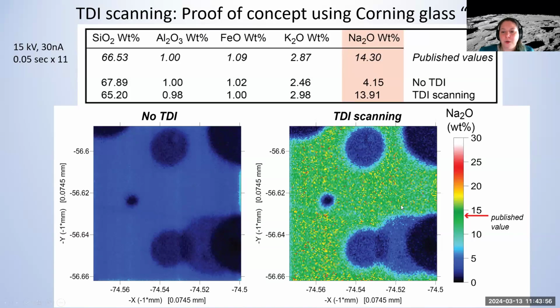But with a mapping, all the dark blue ones, even in the corrected value, are previous analysis spots. And you can see that they have lost various amounts of sodium. But here in the main area, that's where I can now securely export my data from, knowing exactly where it's, so to speak, fresh.